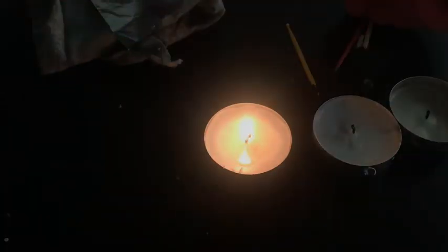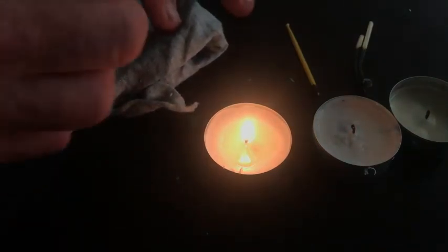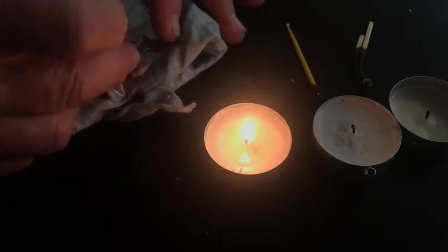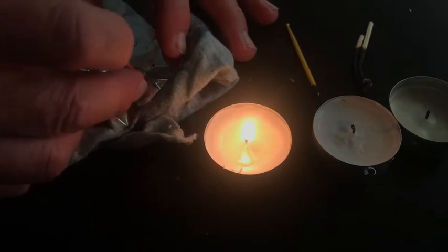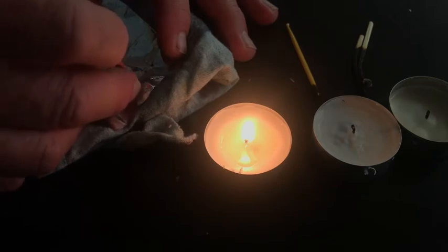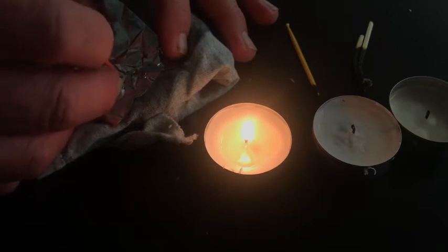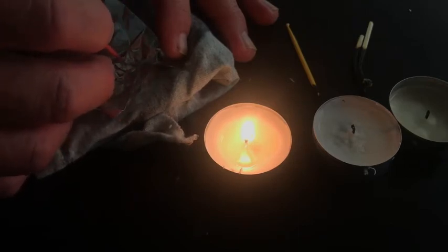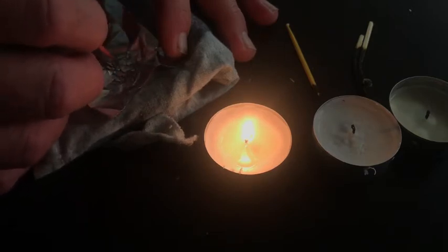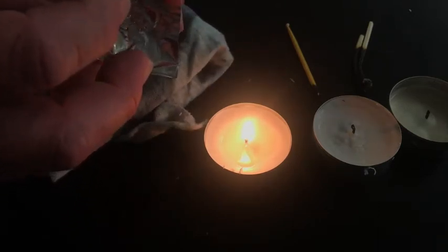I get to use a screen, but I did want this to be an at-home activity. So you can make a screen by taking a piece of aluminum foil and making holes in it at a regular pattern. And then I sort of offset them and I try and create a pattern. Now I don't need very much of a screen. I just needed to cover the flame. So there you go. I have created this screen.